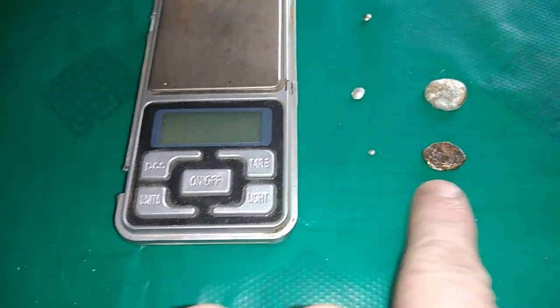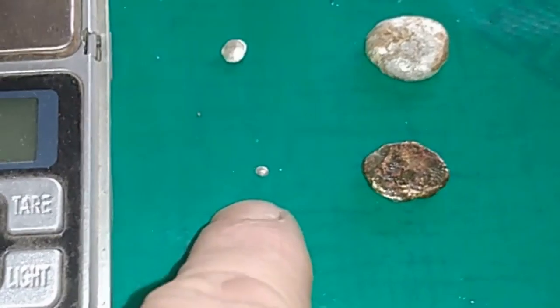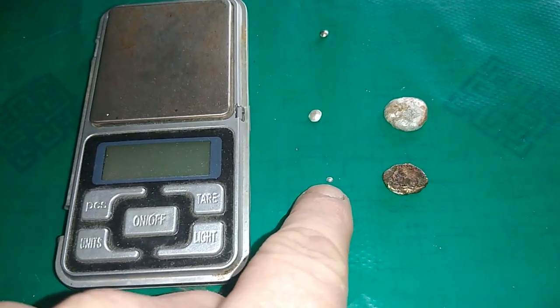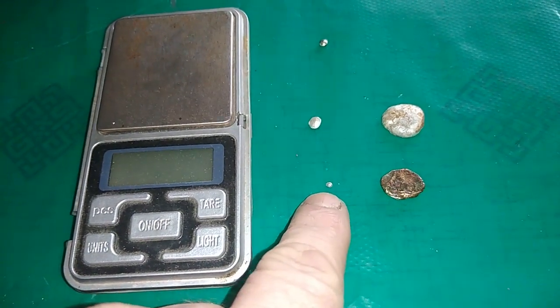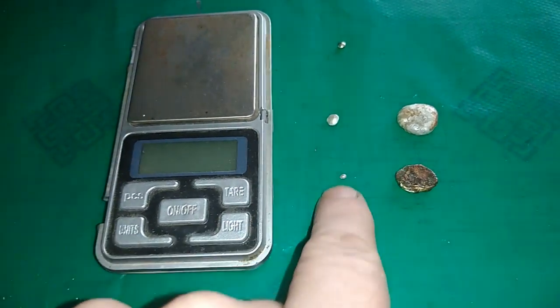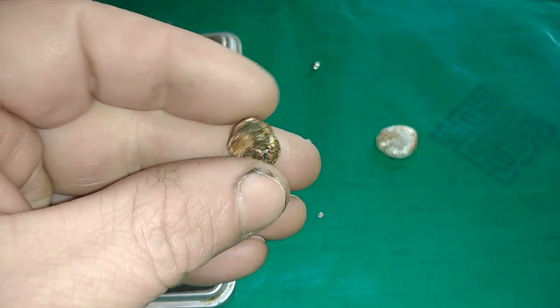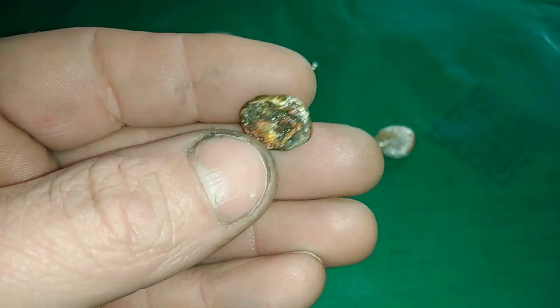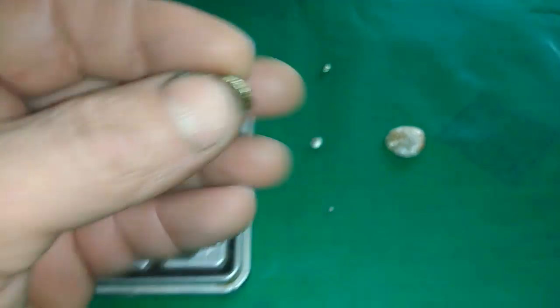See that? First line. This very, very small little white bead and that dirty silver bead — these two are from magnetic MLCCs. So I have some palladium. This is palladium from that smallest beaker from the last video. When I drop with the chlorine gas that palladium — not too much, just a very small bead. And I got some silver — a solid amount. But the problem is I need to soak that. See that? It's very dirty. This is actually borax — dirty borax. So I need to soak that in hot HCL to remove that borax.